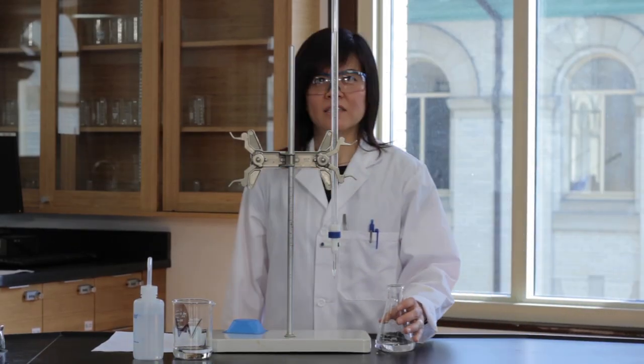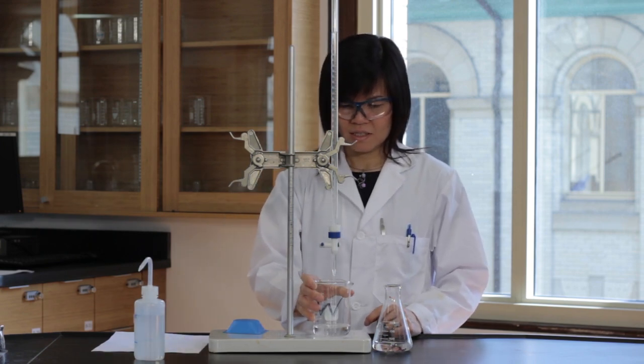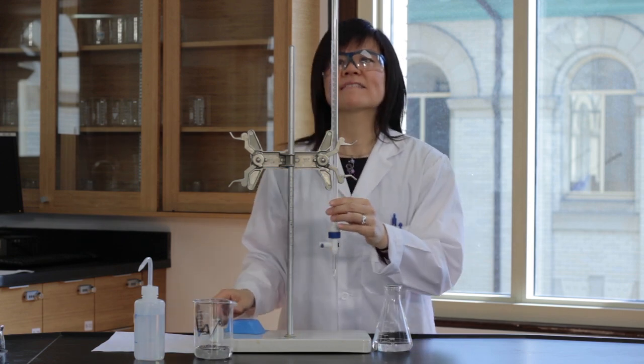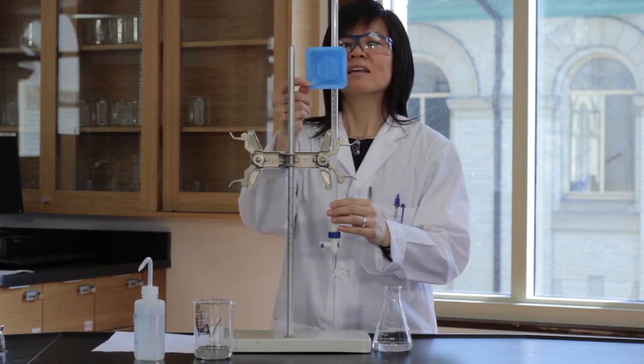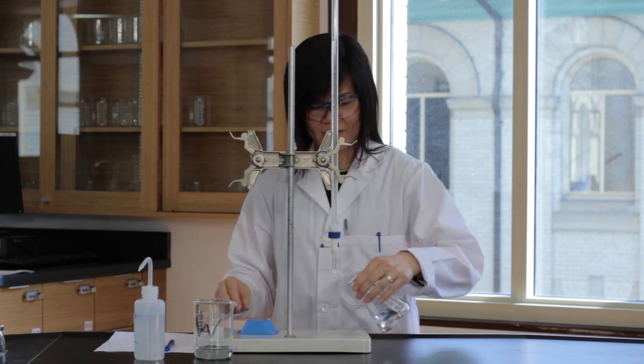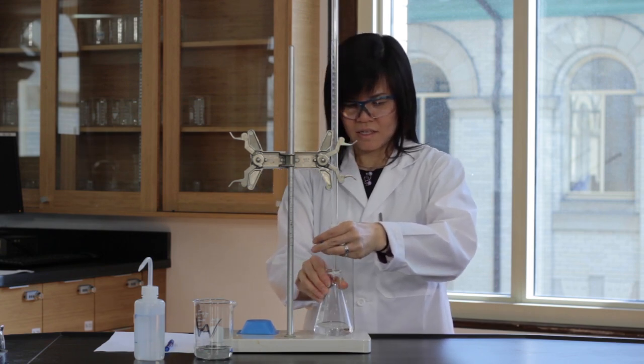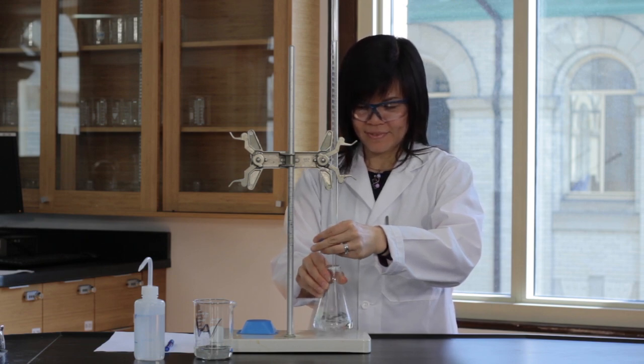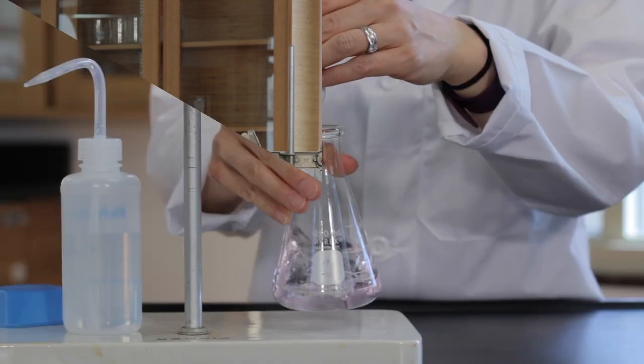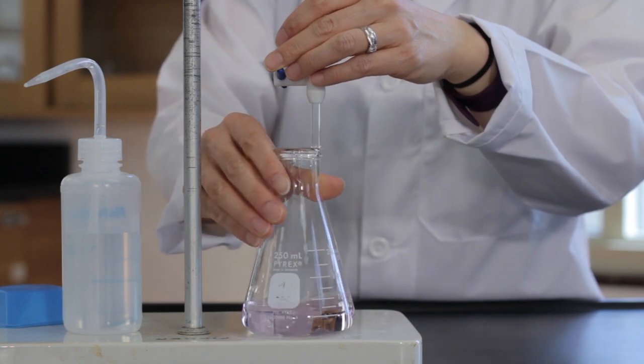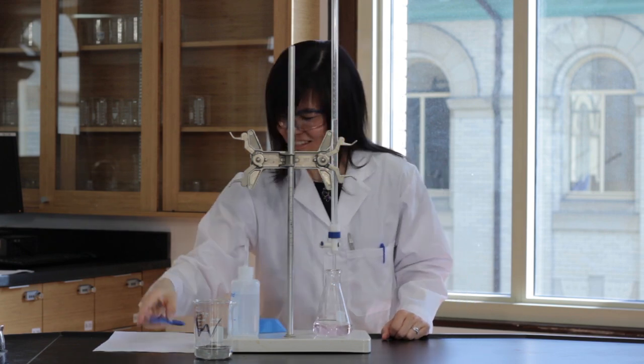Titrate with the standard sodium hydroxide solution to the endpoint. The solution will be a faint pink when the endpoint is reached. Record the volume of sodium hydroxide used in the titration.